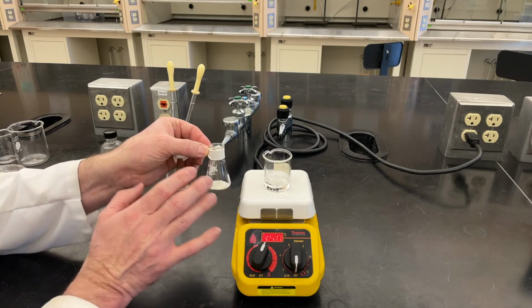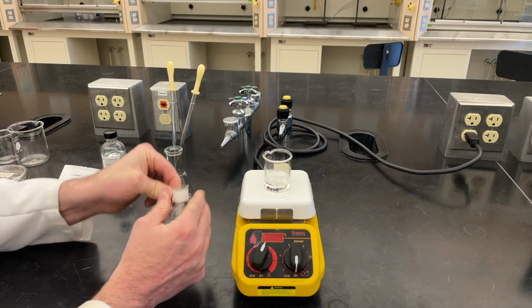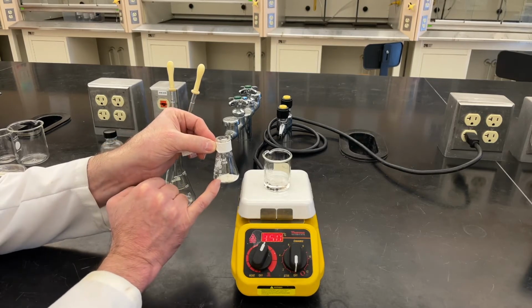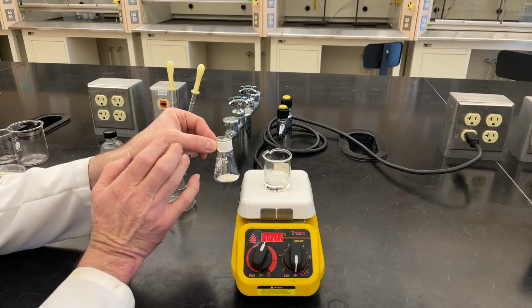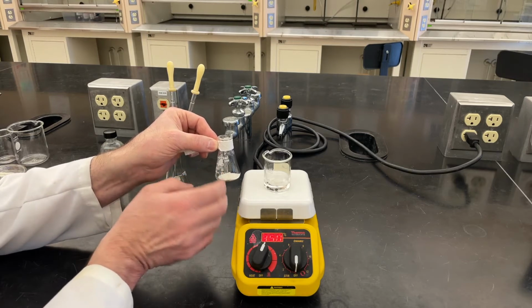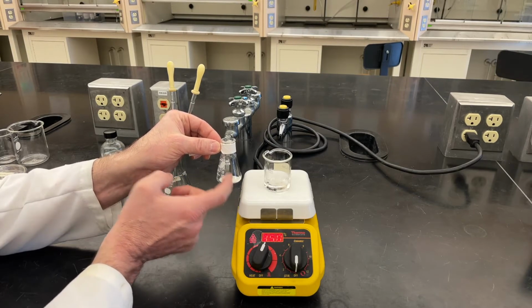Now, I know that you guys haven't done recrystallizations before because you didn't get to do first semester of OChem. So we're going to talk about how we do this recrystallization. First thing is, we never just want to put this down on the hot plate without any solvent in it. The potential for melting the solid is high. And if I melt the solid, the melt does not like to then dissolve into the boiling solvent to recrystallize very well. So I always want to wet this with a little solvent before I do anything else.